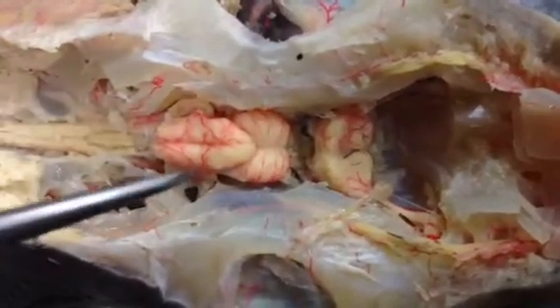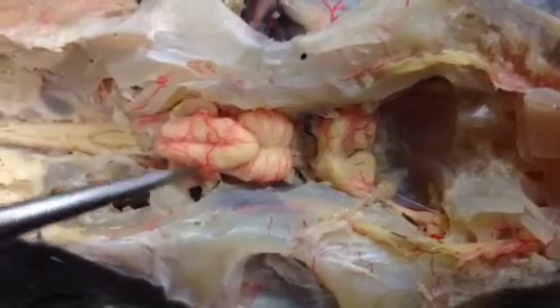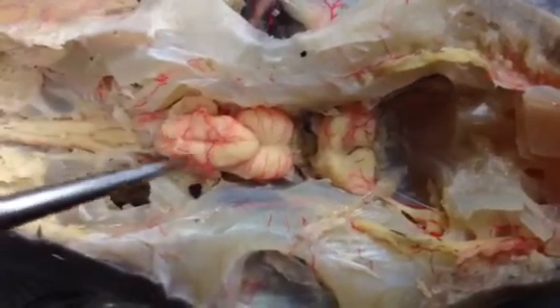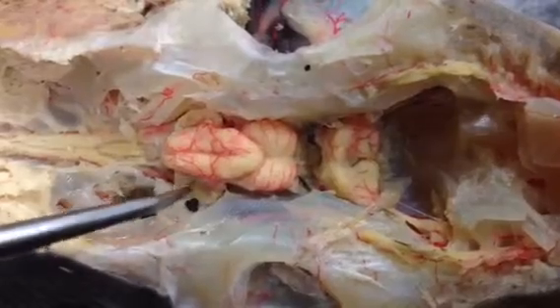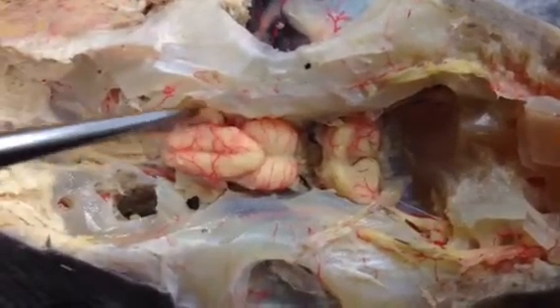And then you have the metencephalon. This is the body of the cerebellum, and then these are the auricles of the cerebellum.